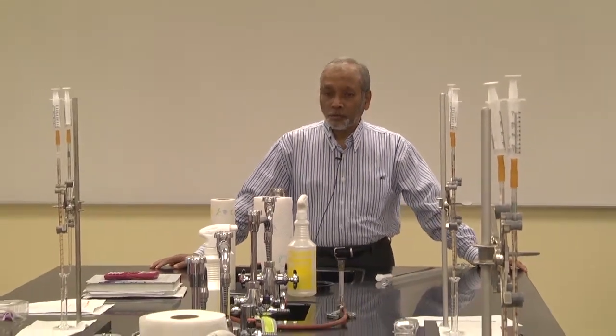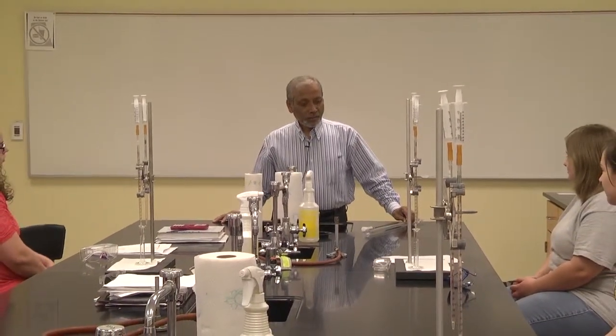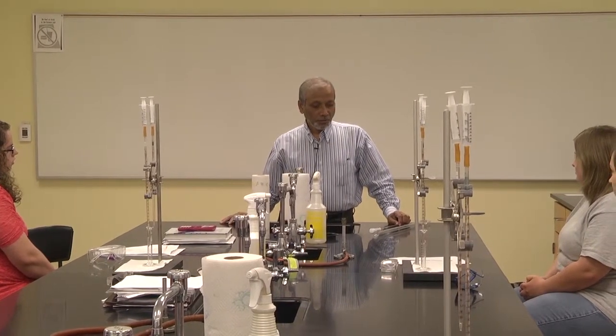So in this experiment, you are going to use vinegar. Everybody is familiar with vinegar, right? What is there in vinegar? Acetic acid. So vinegar contains acetic acid, right? So one of the questions can be, how much acetic acid is there in vinegar? Can we find that out? That's exactly what you are going to do today in this experiment. You will calculate the amount of acetic acid in vinegar.